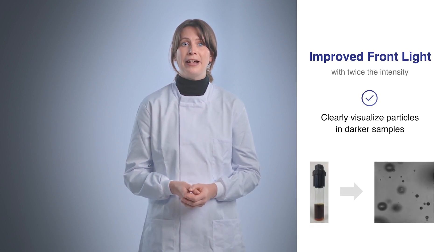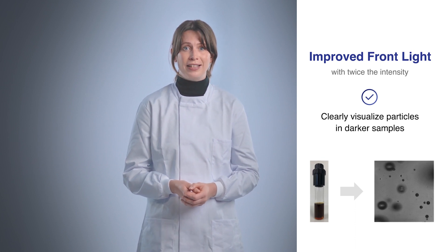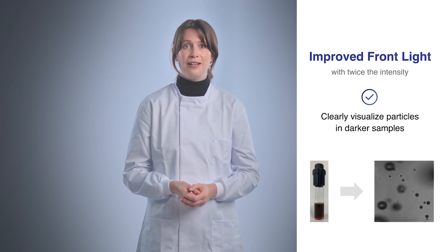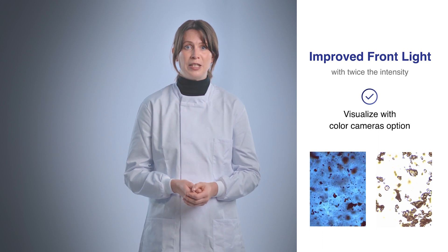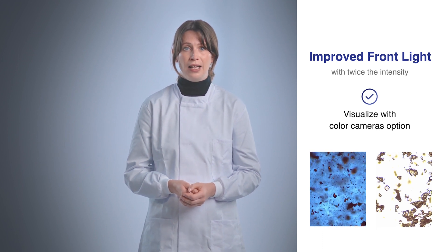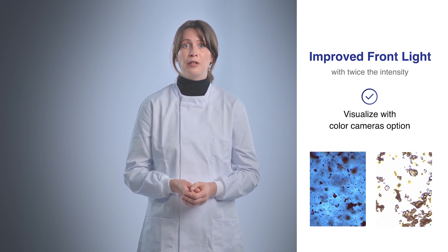The Crystalline version 2 makes use of front light which has twice the intensity of the previous model, allowing operators to visualize particles clearly in darker samples. The user can also choose to visualize their experiments in color by making use of the color cameras option.